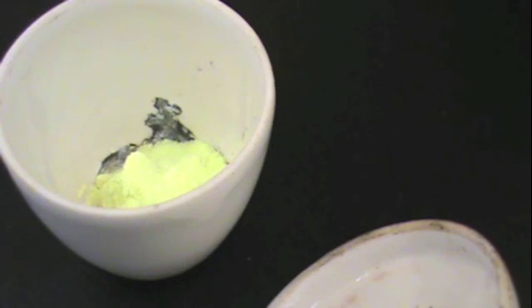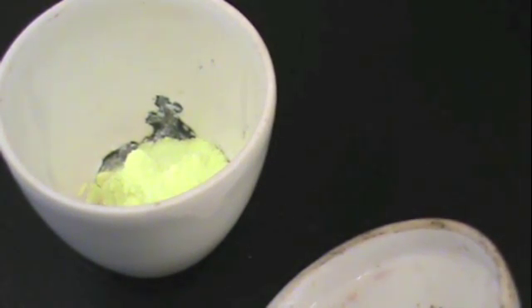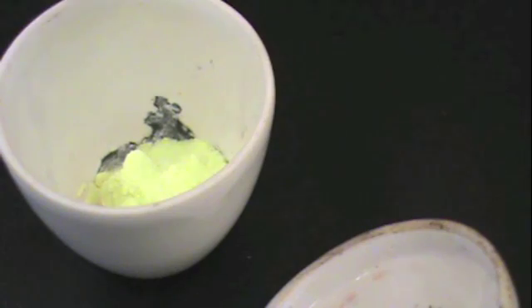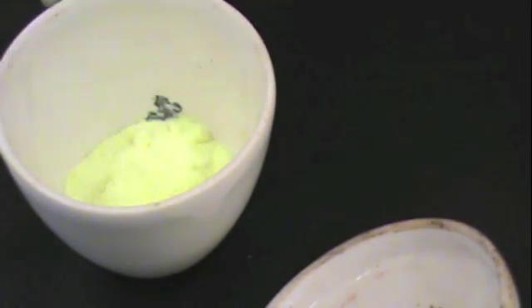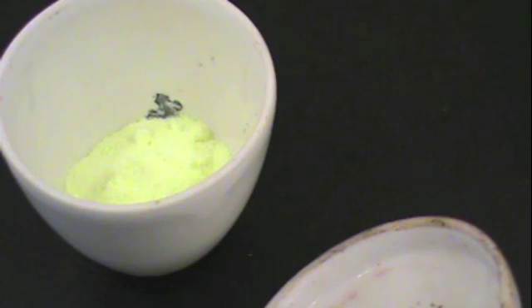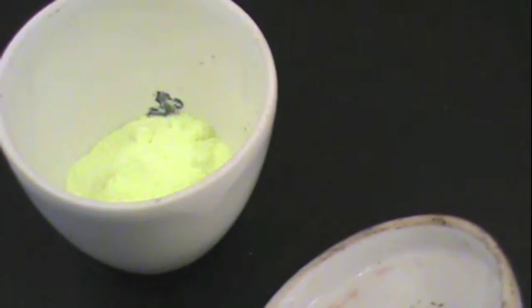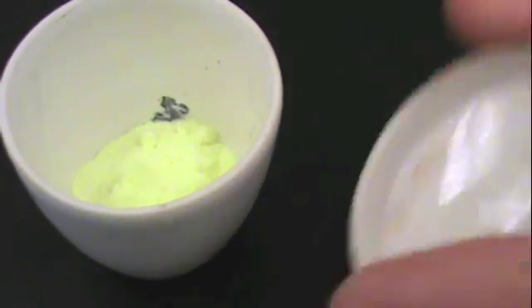Then begin adding sulfur directly to the copper wire. You will want to add enough sulfur so that you completely coat the copper wire, as shown here. You will not need to weigh out the amount of sulfur because we are adding an excess to this reaction to make it go to completion.